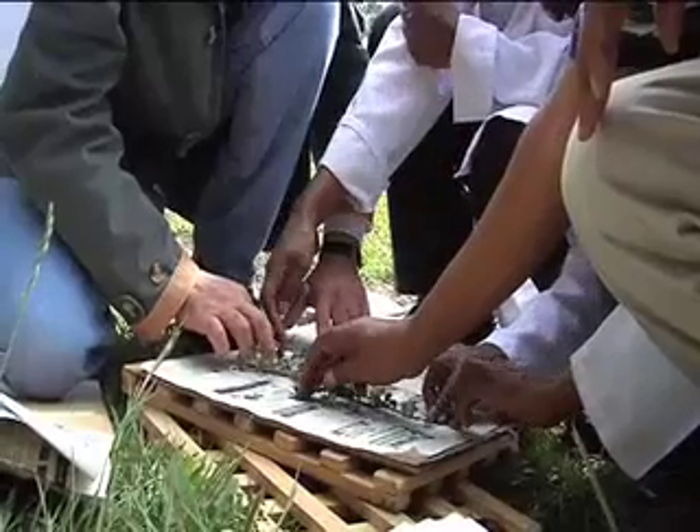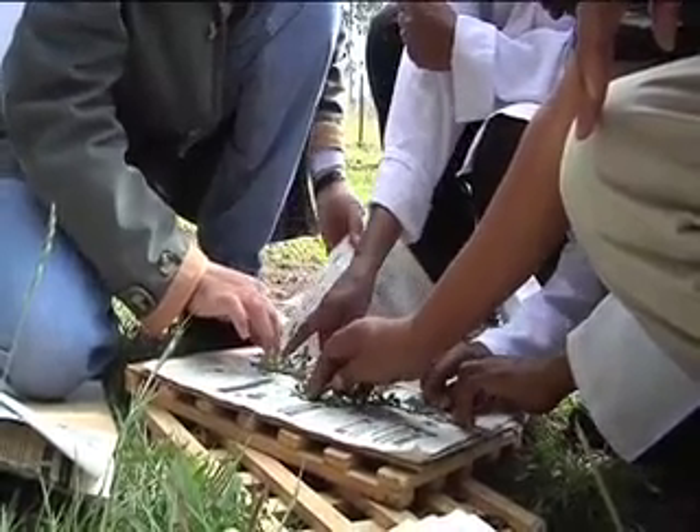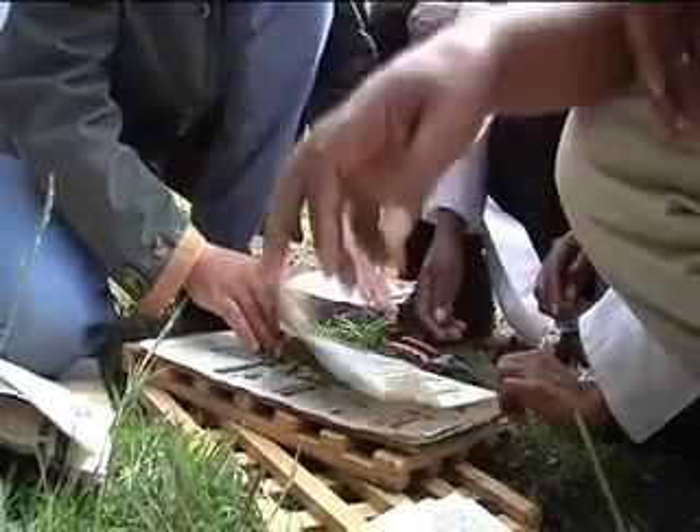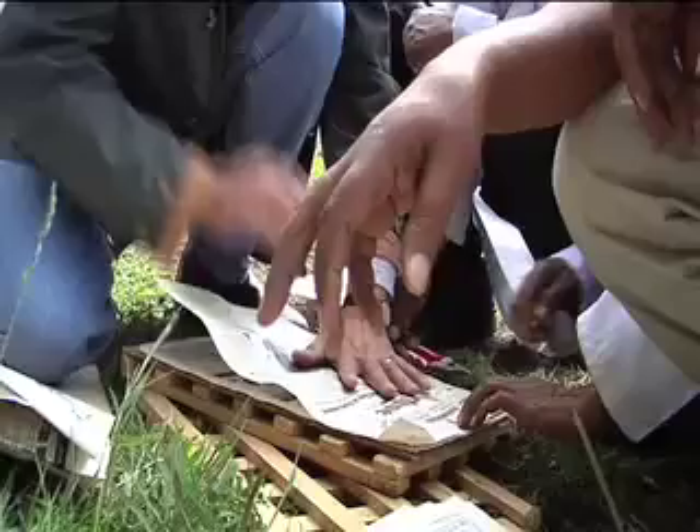The wooden press is used to dry the leaf samples for several days. The moist paper should be changed and replaced with dry papers to avoid mold growth and discoloring during the drying process.